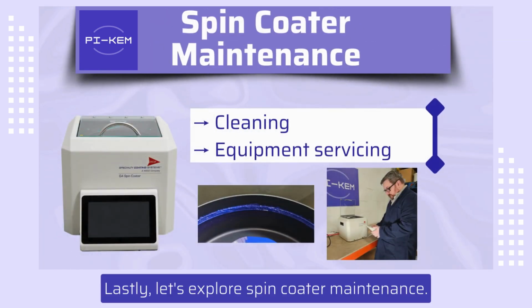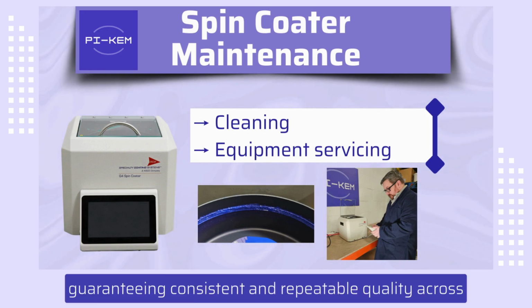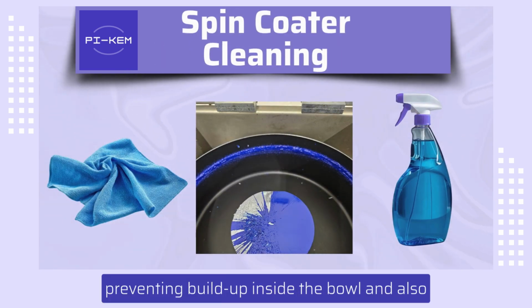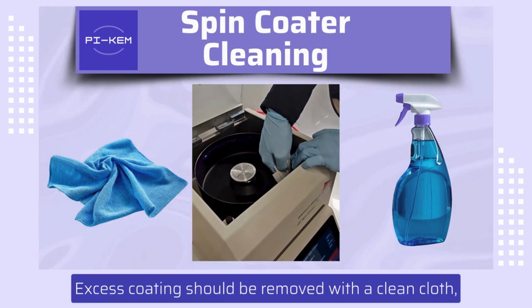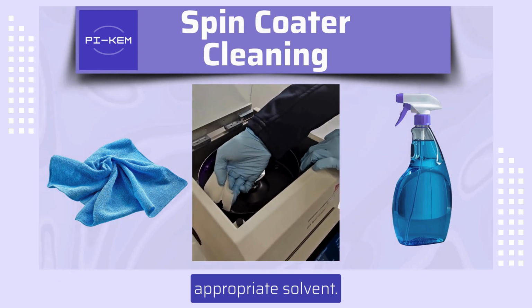Lastly, let's explore spin coater maintenance. Proper maintenance of your spin coater keeps it performing at its best, guaranteeing consistent and repeatable quality across successive coatings. Cleaning after use is an easy way to maintain your spin coater, preventing build-up inside the bowl and also mitigating contamination between successive coatings. Excess coating should be removed with a clean cloth, and then any remaining residue can be removed with an appropriate solvent.